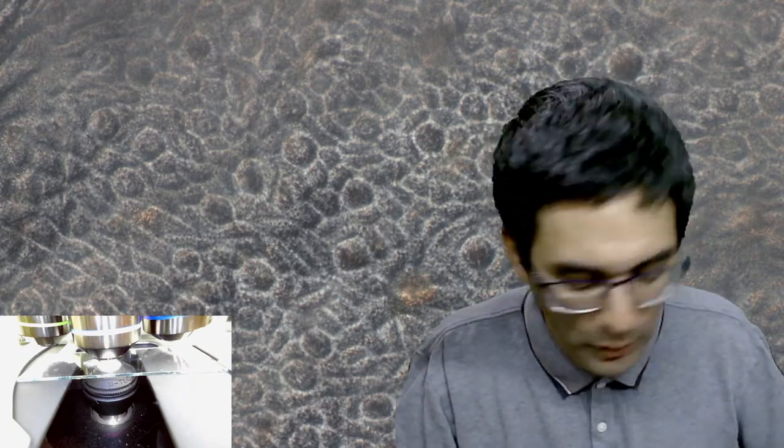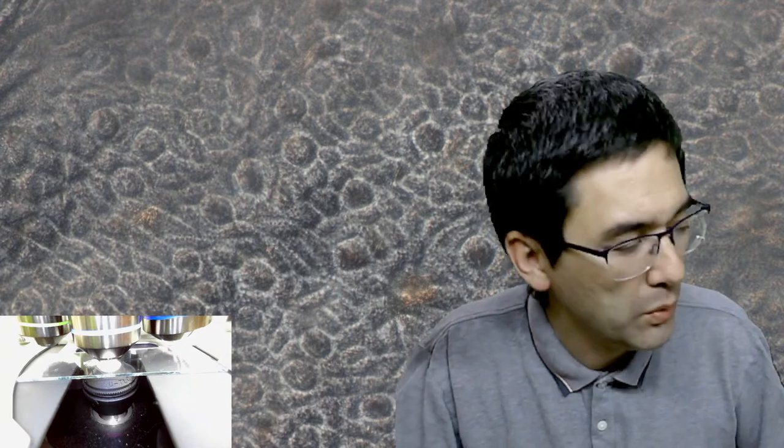I kind of like this technique quite a lot because it's a really easy way to visualize stomata. I've been using this myself as a lab activity since I'm also a biology teacher in school - to demonstrate this to students. If you look at those round things, you might sometimes see a small little hole in the middle.